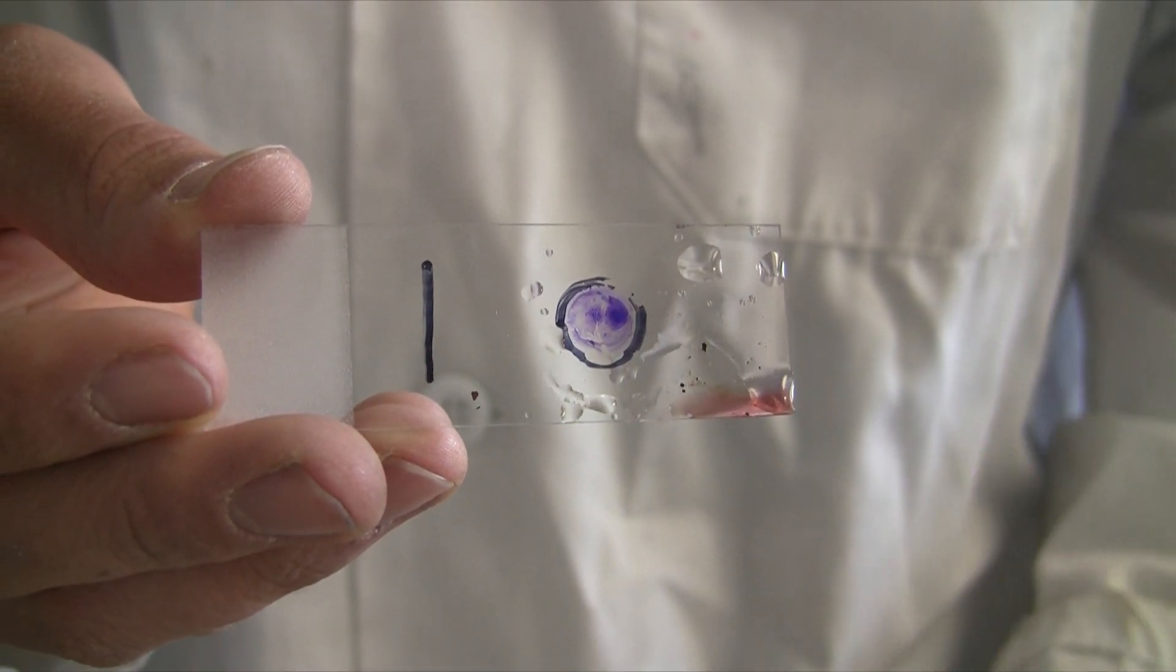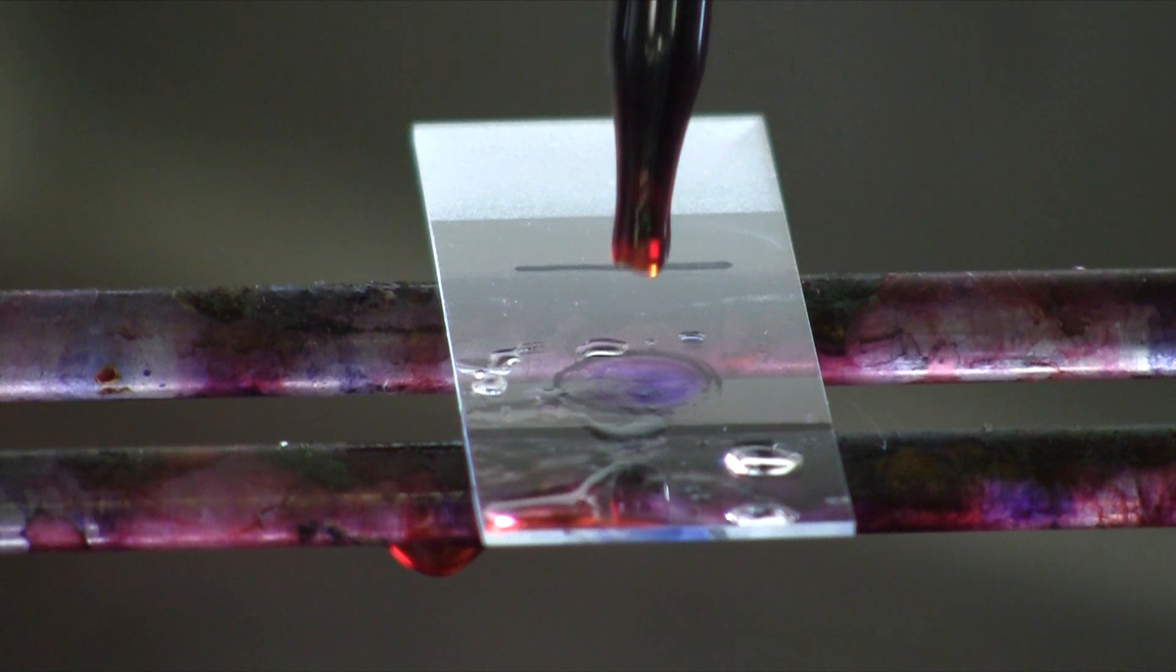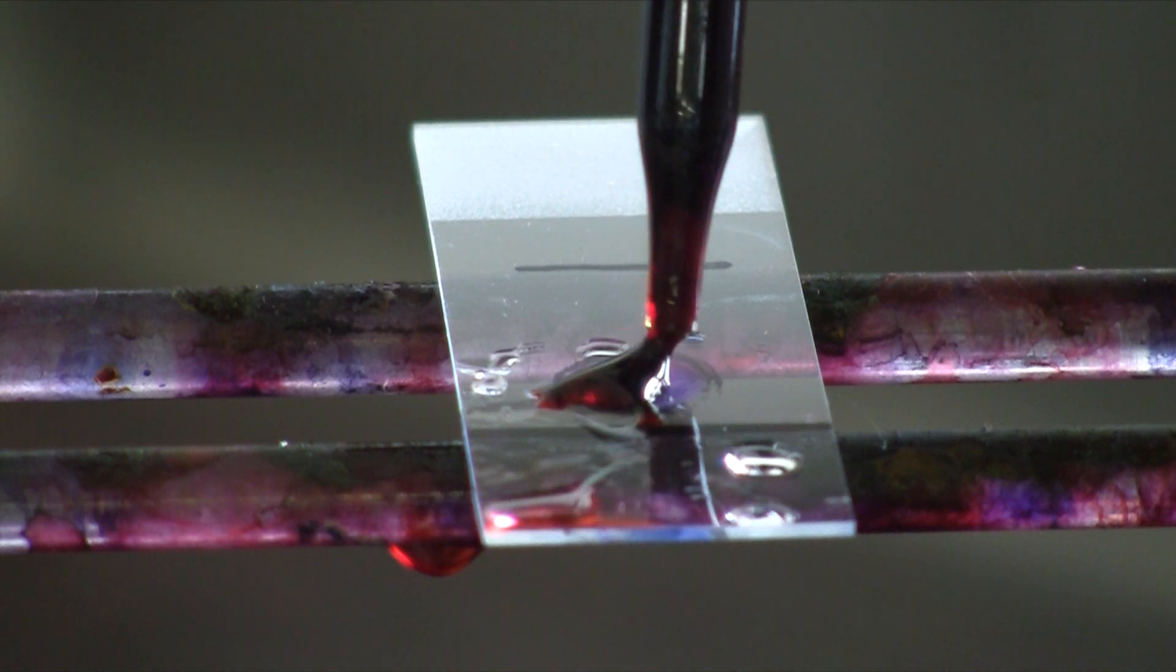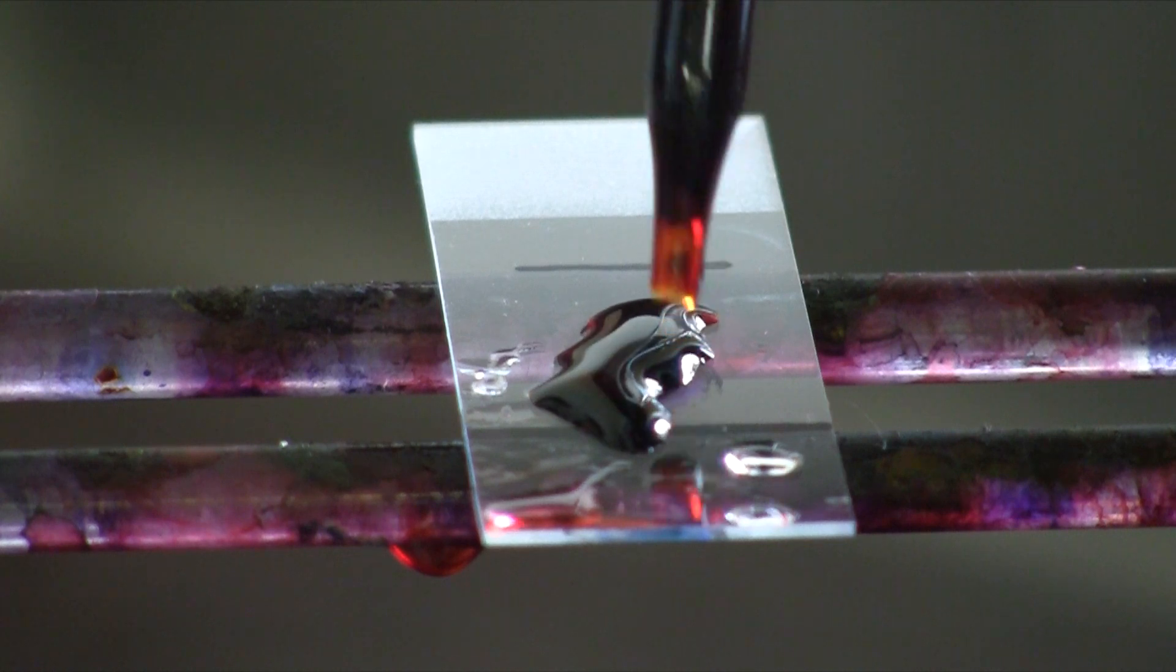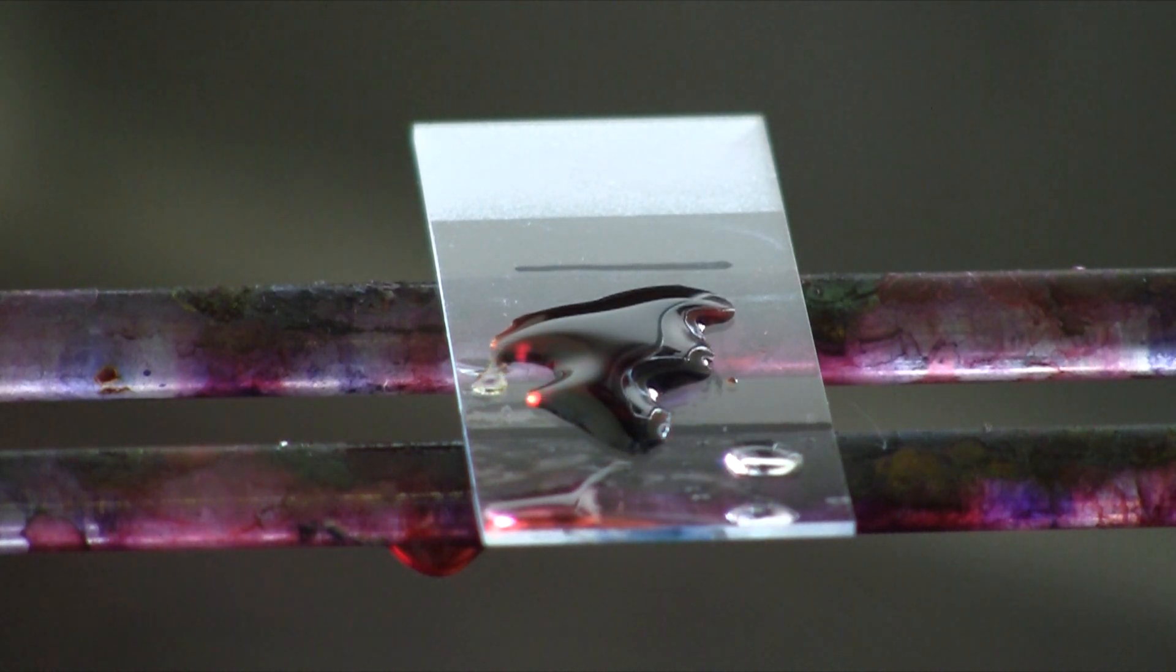And we'll be now placing iodine as a mordant. The mordant will help enhance the staining. It's kind of like wearing mascara. It enhances that crystal violet dye. This will sit on the stain for one minute.